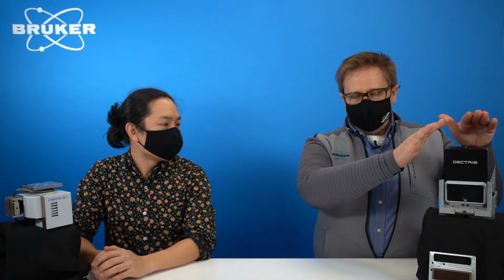And then the one other difference is what they're optimized for. So this one is optimized for highest count rates. So you never need to use a copper absorber with this. This is great for thin film, and very large field of view, which I think is very important. So this is great for multi-purpose materials research with that high dynamic range in mind.